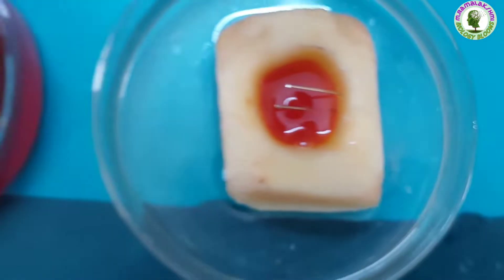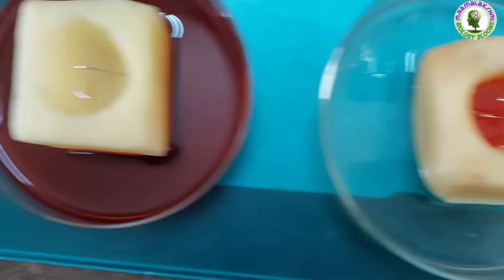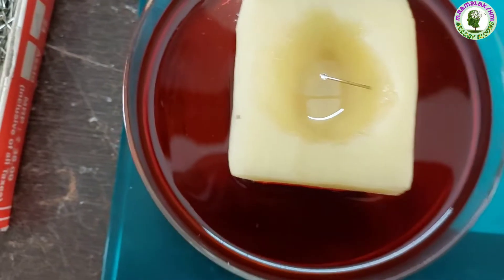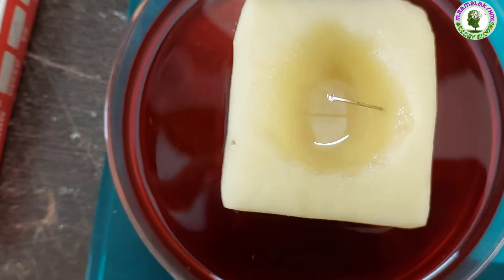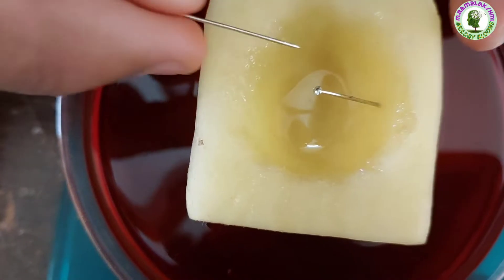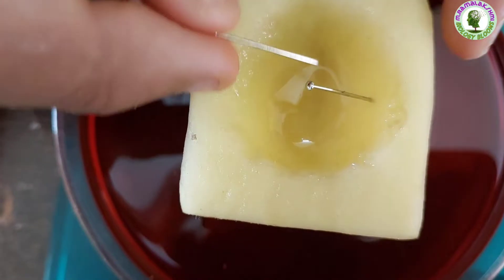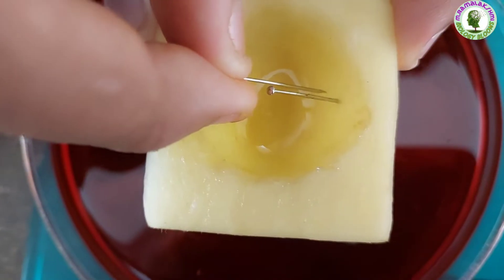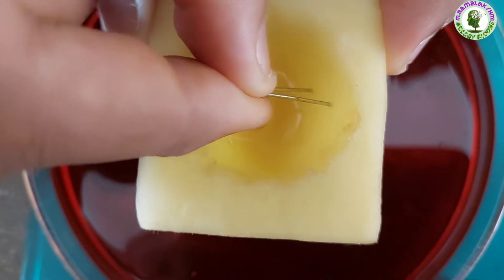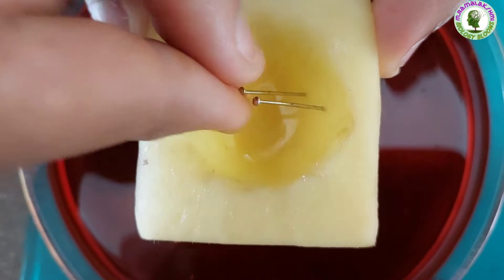Harish, what do you notice? The water level in the second potato cup has decreased, ma'am. Good, Harish. Mark this decreased solution level also with the needle.